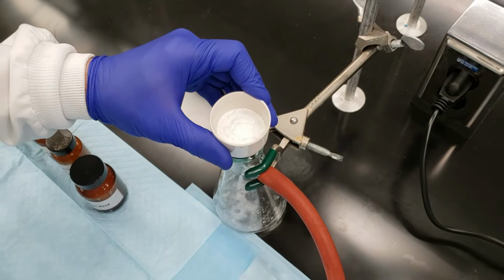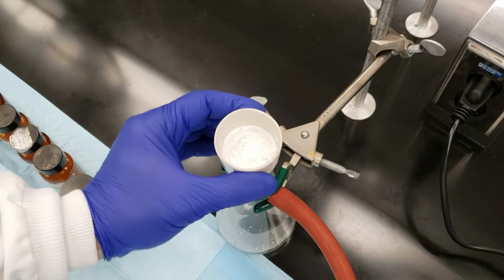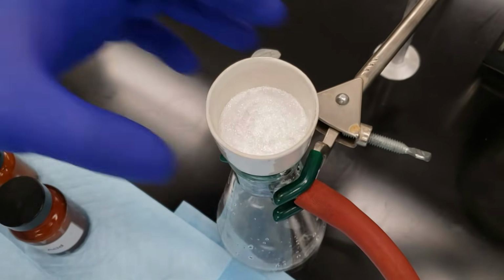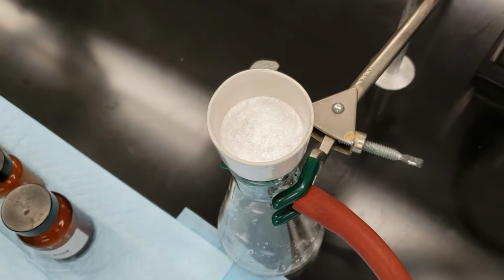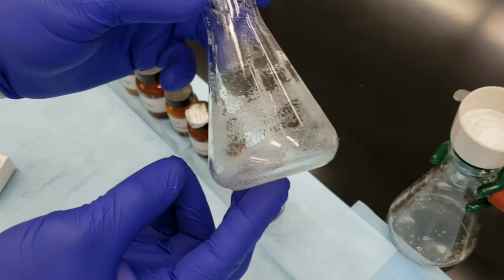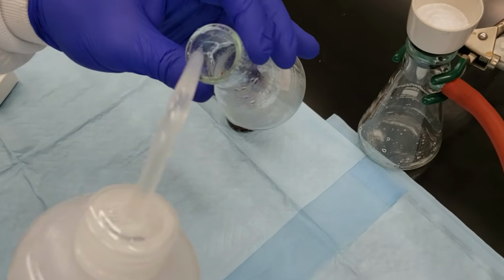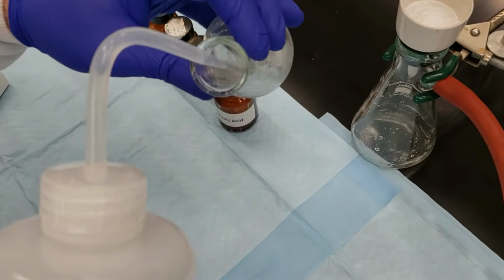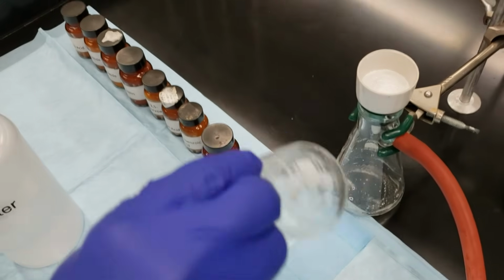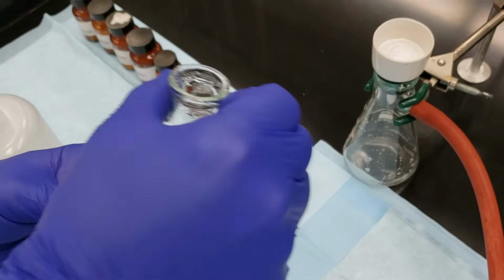All right, so we've got a good seal. We're pulling our liquid through our crystals. We've trapped that on the filter paper up top, where we can scrape it off in just a minute. Now I still have some crystals remaining in my original flask. So what I want to do is use my DI water. I'm going to rinse through with a small amount of water here, not too terribly much, and try to get as many of those crystals as I can into my Buechner funnel. I don't want to leave anything behind if I can help it.